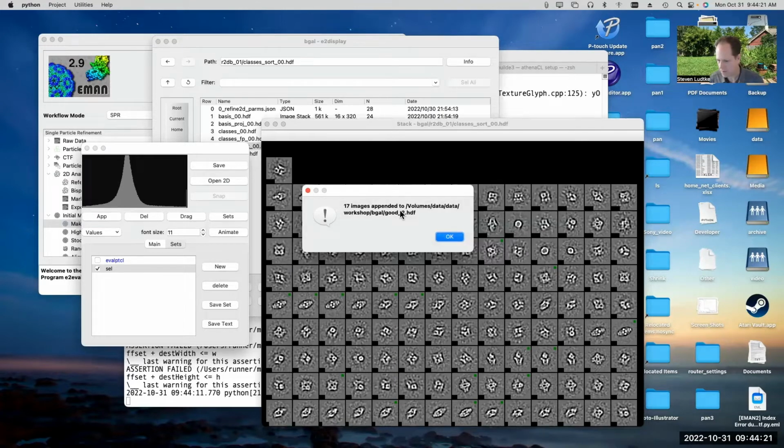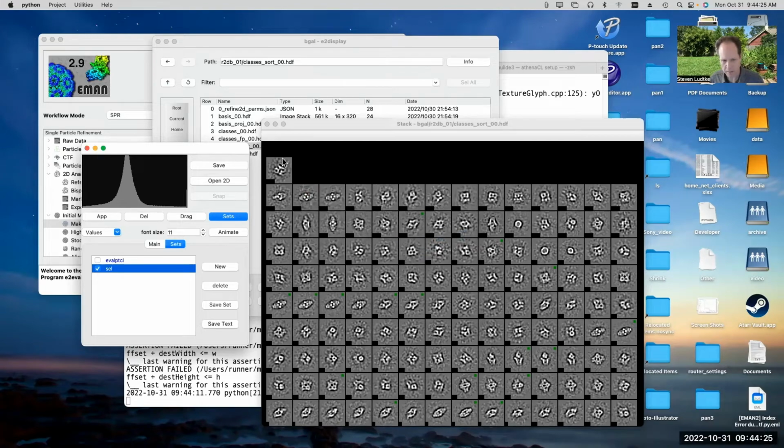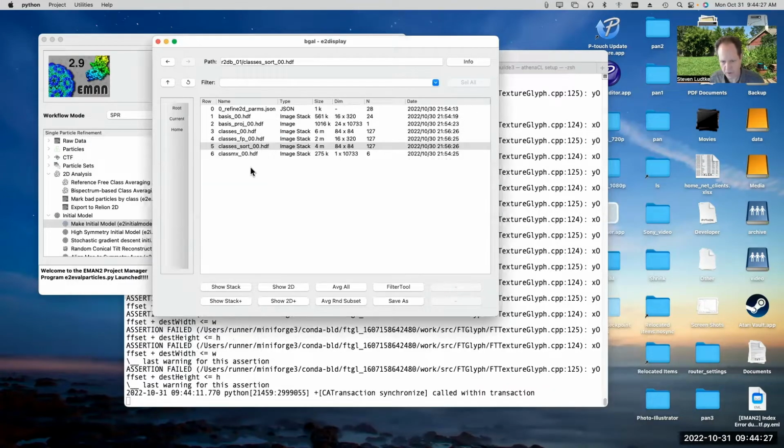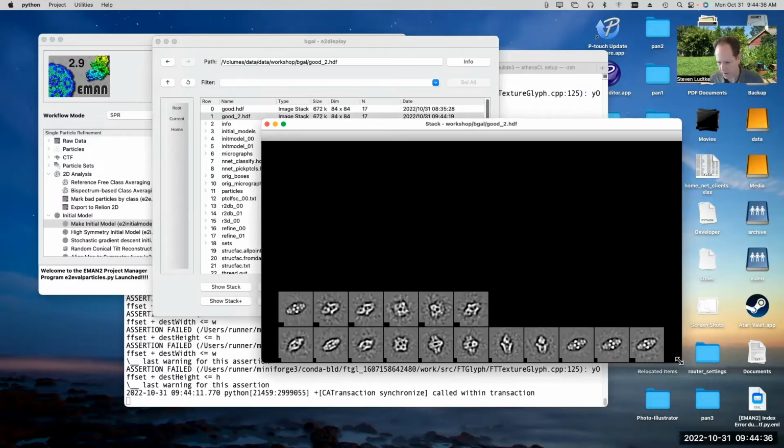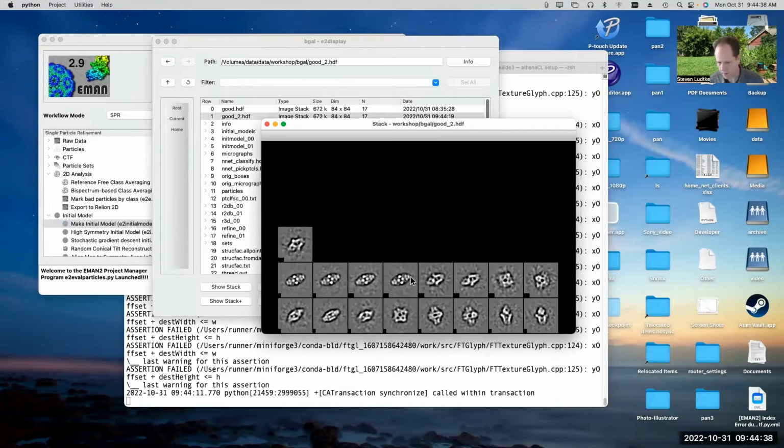Okay, 17 images appended to good2.hdf. So now if we close out of this and go back to the main folder, you'll see we have this file good2.hdf. That's when I did it earlier. And if we open it, you can see only the particles that I'd selected are shown here.